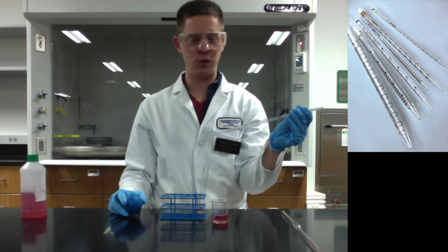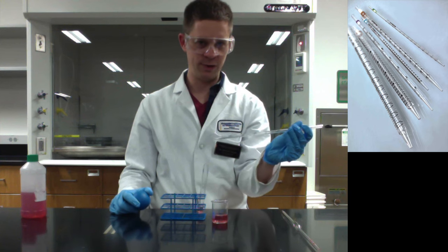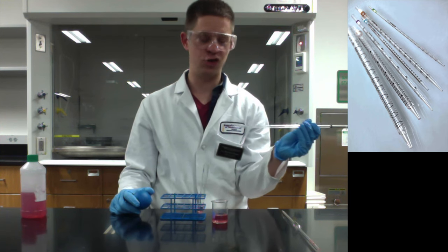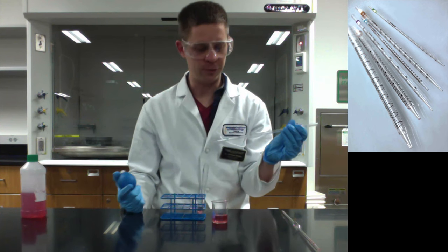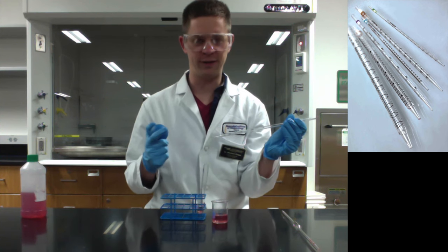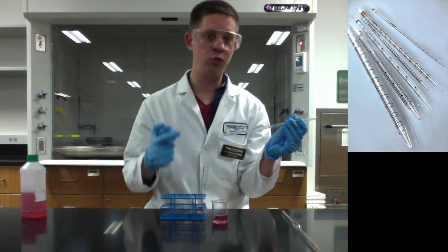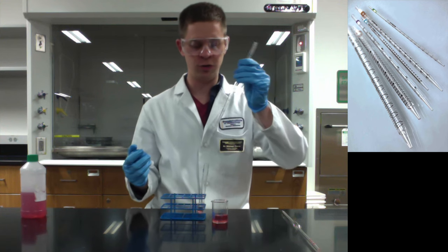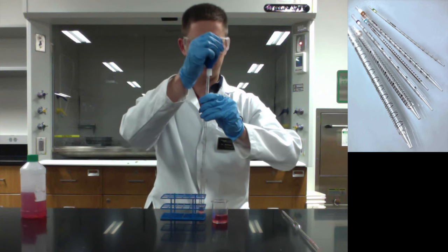Now we have the same issue that we had with the volumetric. There's liquid left in the bottom of the serological. The question arises, should I deliver this or not? If you think about it for a second, there's no zero line on this. The zero line is assumed to be nothing in the serological pipette. So for the serological, you do actually have to blow it out like so.